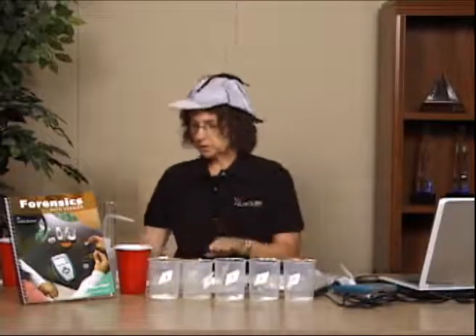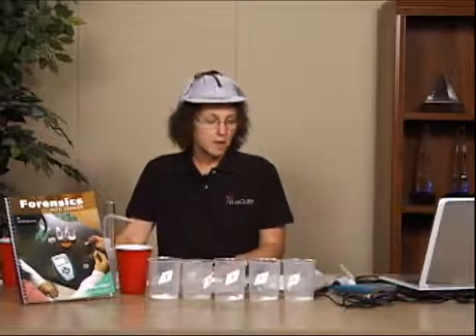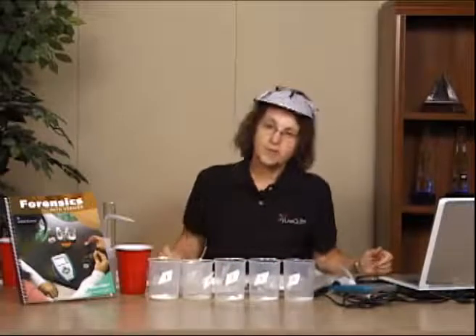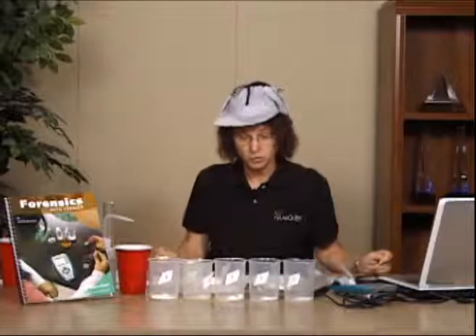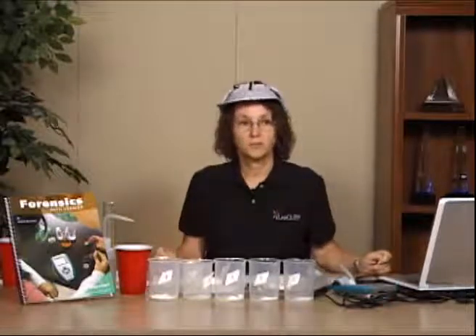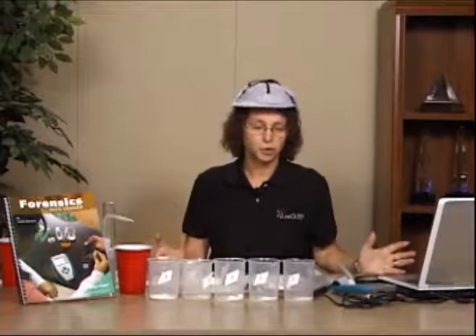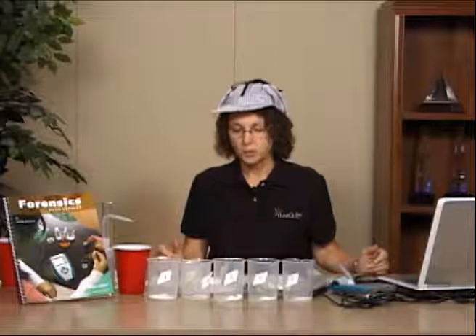And if you take a look at the teacher's notes in the books, they give you some suggestions for those powders, and I've taken some of those powders and put them out here. As a classroom teacher in a high school, using real drugs obviously isn't going to be a very good solution for us, so we've actually used some very common things like flour and baking soda and baking powder, salt, sugar, and any other white powder that kind of looks the same for students.